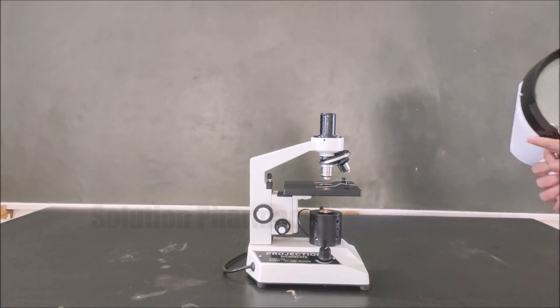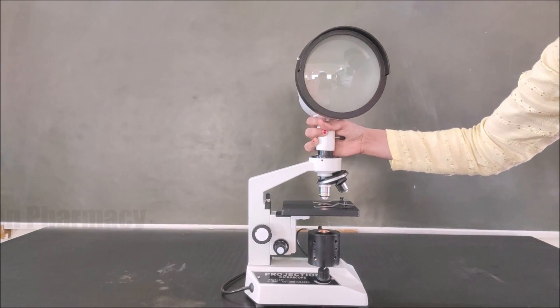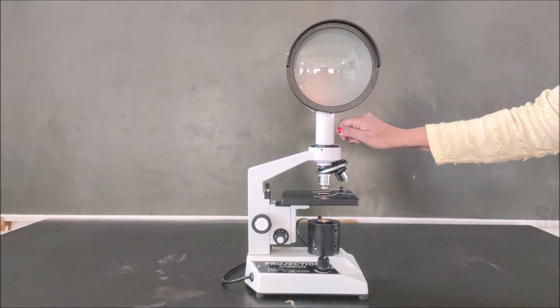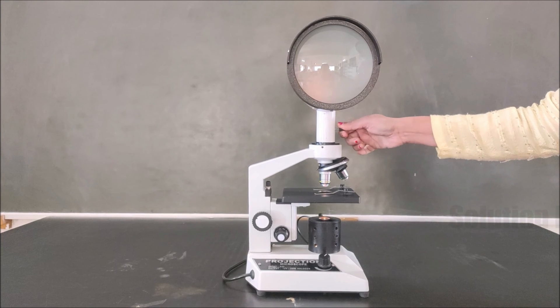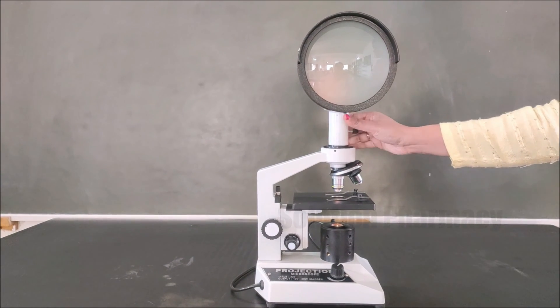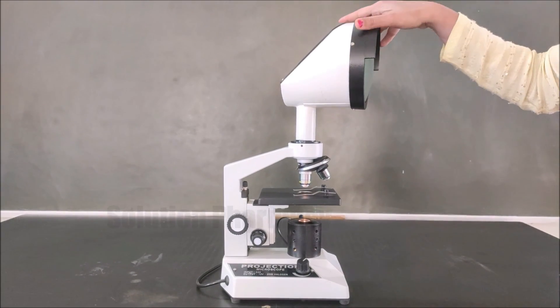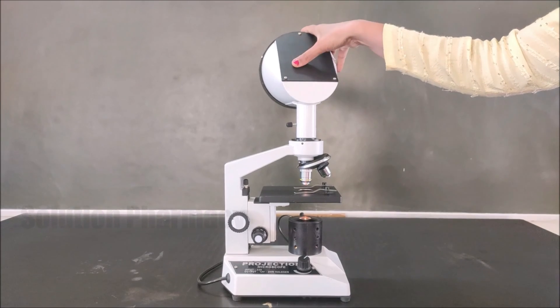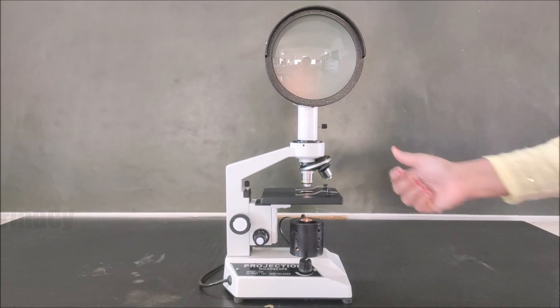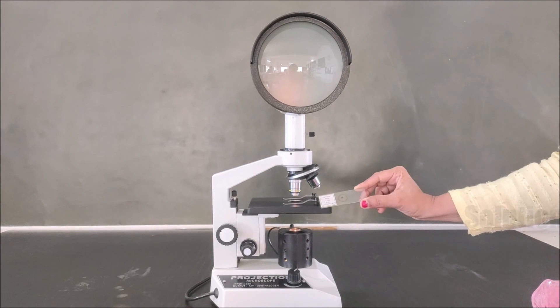The screen is the main part of the projection microscope. We attach and fit this screen at the top of the microscope in the eyepiece tube, then tighten the screw to fix it in place. When we loosen the screw completely, we can rotate the screen 360 degrees so that we can observe the projected magnified image from any direction.